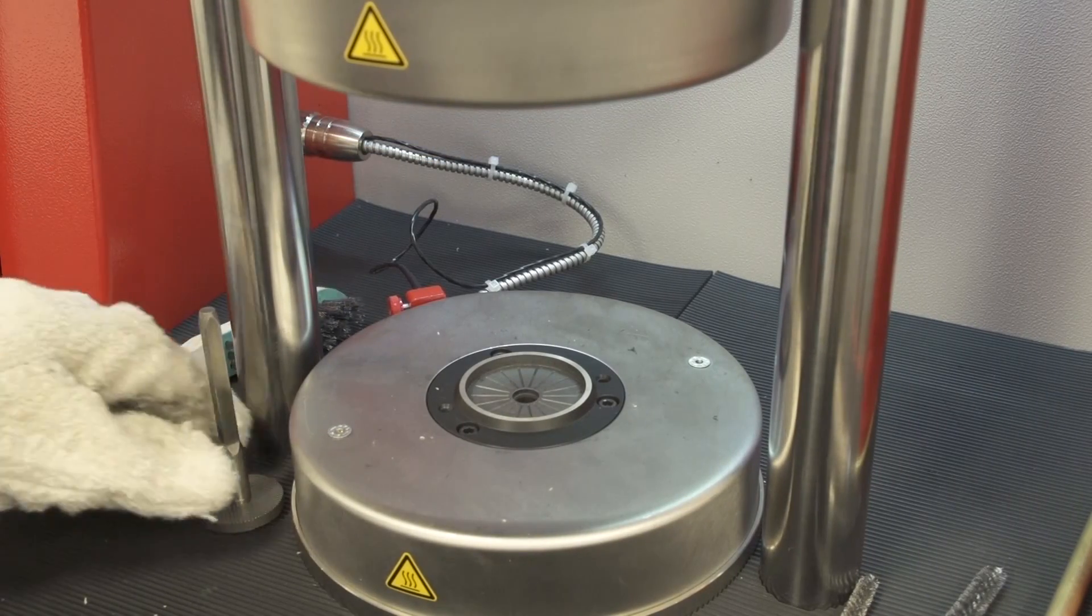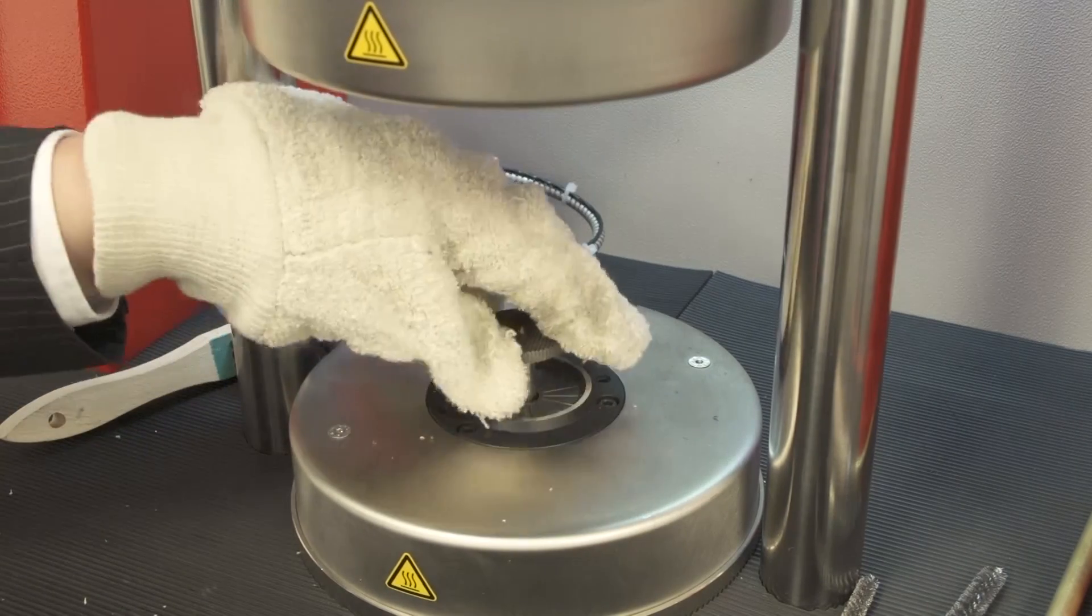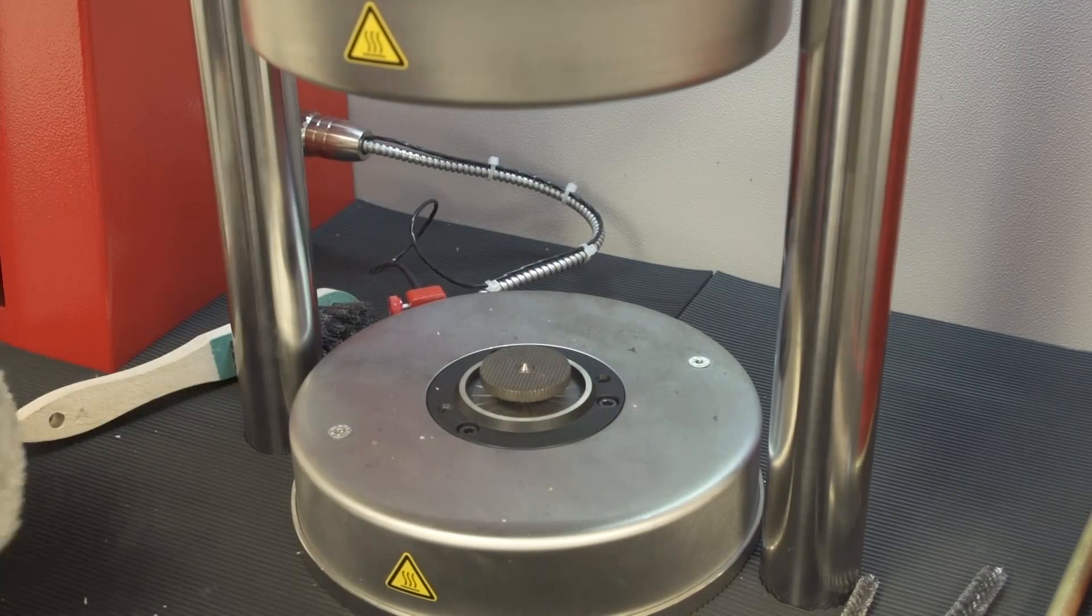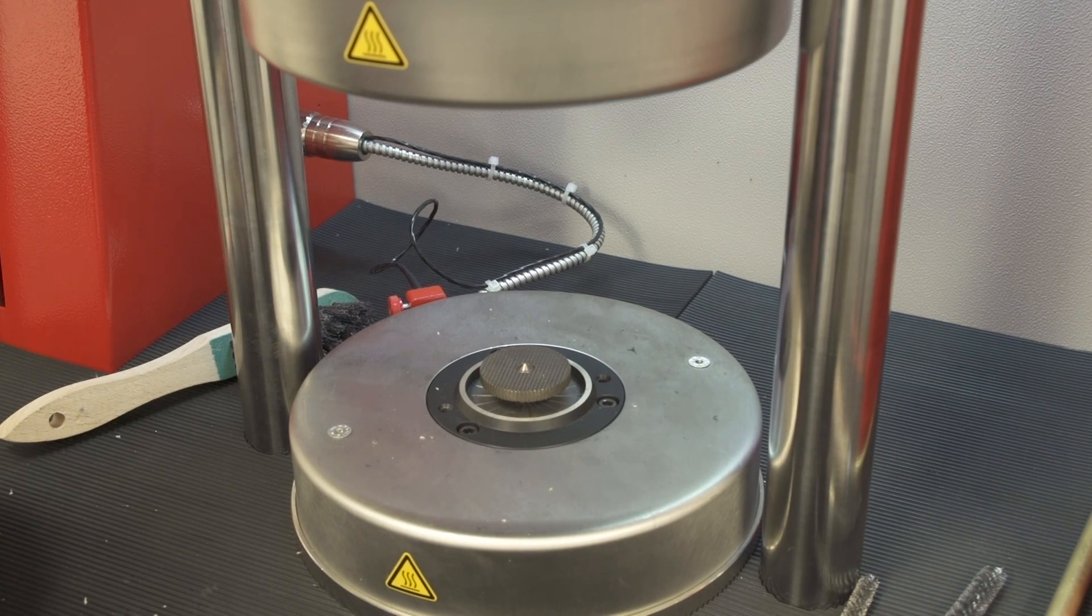Once completed, put the rotor back into the die and make sure that all tools are removed from the die and working area.